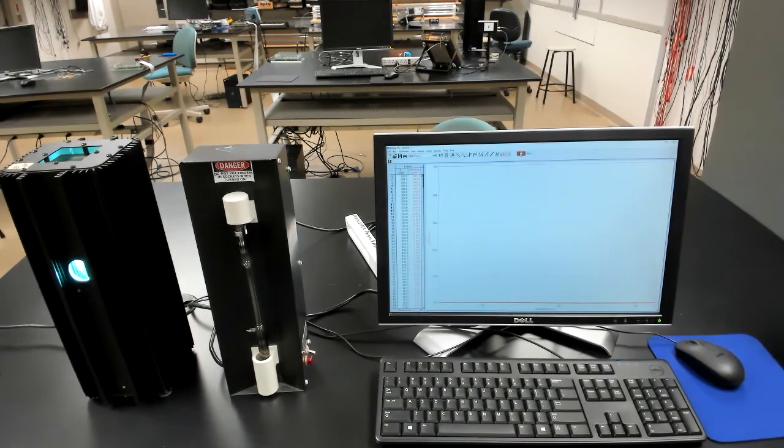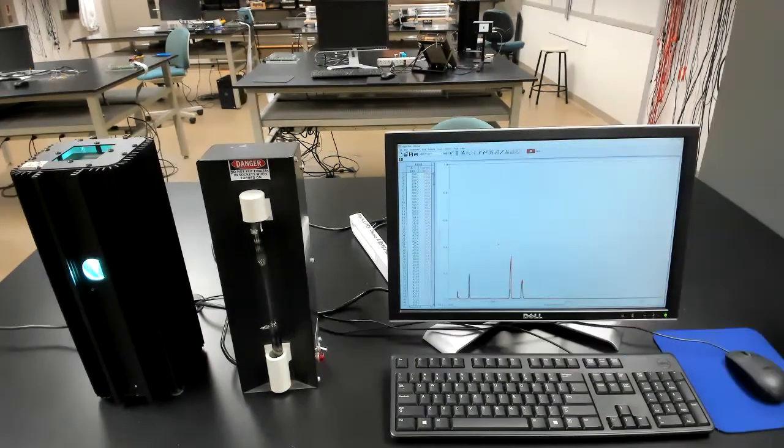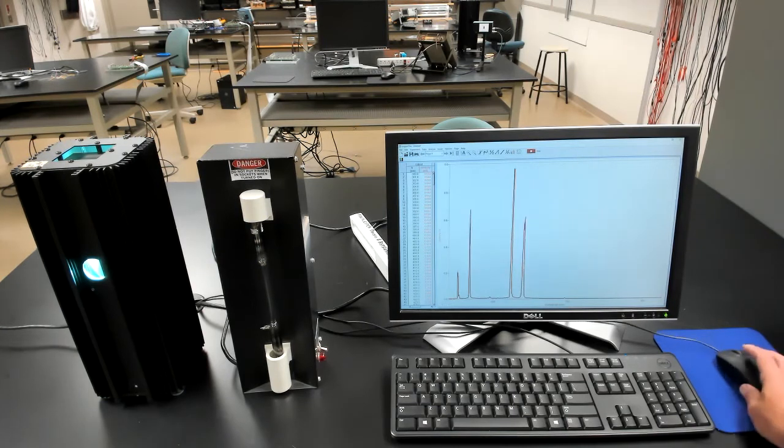Let's go ahead and stop this then. Oh, something I should be careful about before we stop. Notice that if the light intensity is very high, as in here, the lines will get clipped, meaning they'll go to the maximum intensity, and then when the camera saturates or overloads, you won't see the actual peaks anymore. We don't want to be in that situation. Instead, make sure the intensity is low enough so that none of the lines are clipped or saturated.